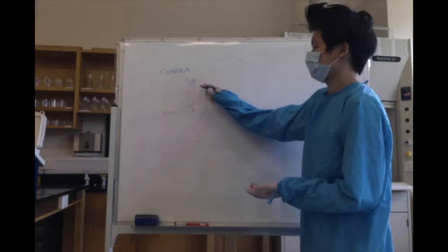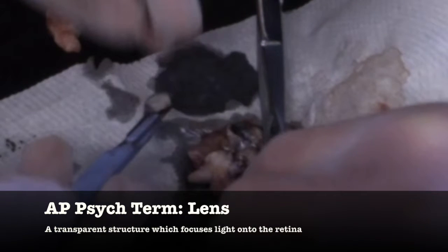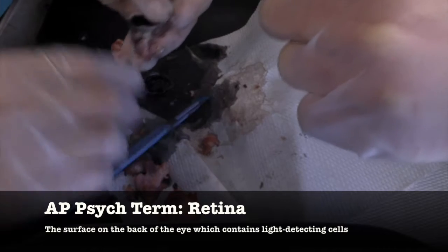Let's talk about the lens. The lens is right behind the iris, and it's basically a transparent structure that can focus light onto the retina, which is at the back of the eye.